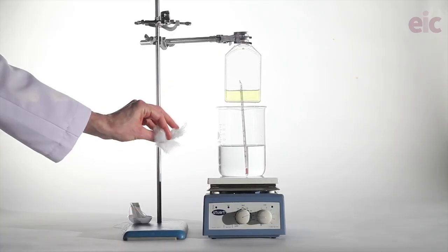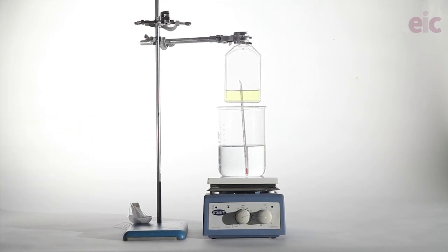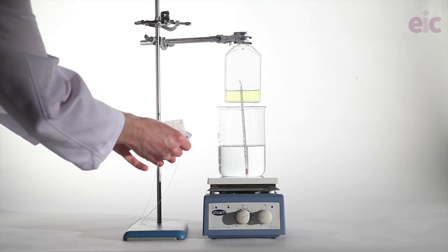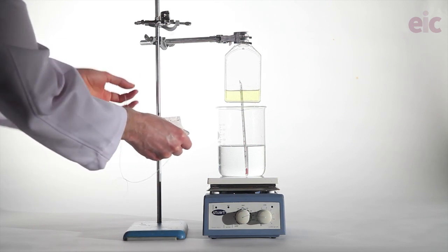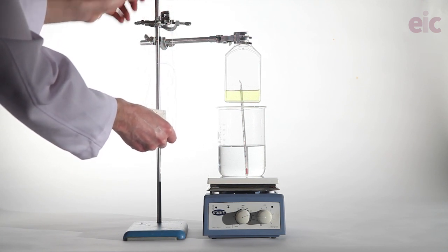I have some cotton wool on hand to place into the neck of the flask and reduce air coming in, but to be honest, I've never found this to be one of the major problems. And unless you're leaving solutions out for more than like a few minutes, you're probably going to be okay.